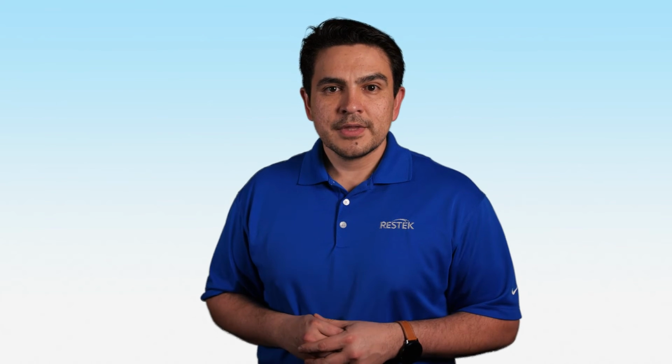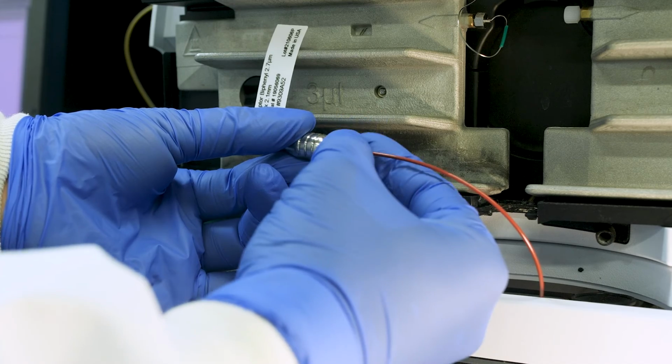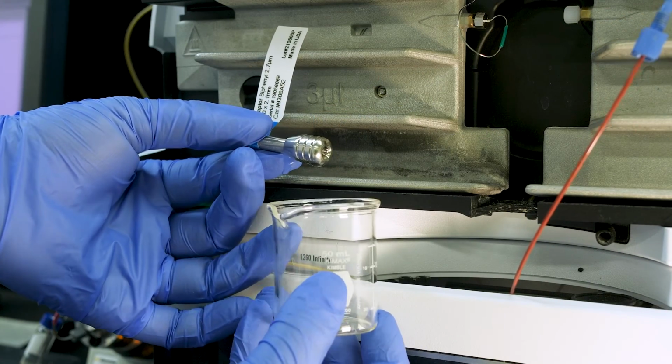The best way to avoid baseline noise is to use HPLC-grade solvents and degas them before use. It is also good to flush your column at the end of the day with a strong solvent, especially if you are using buffers or salt additives. While doing so, it is recommended that you remove the outlet tubing from the detector so you don't further contaminate the cell.